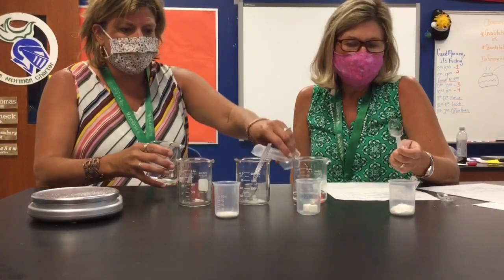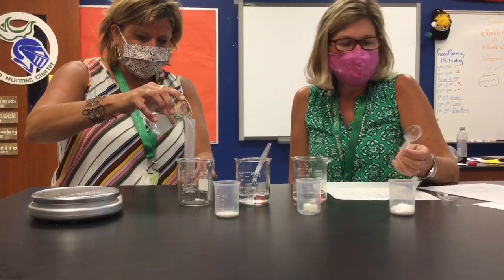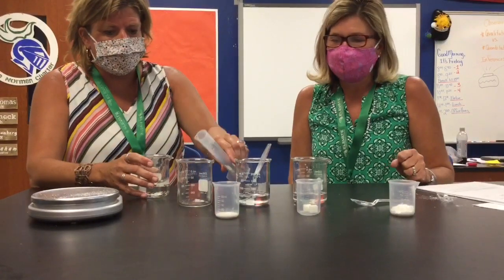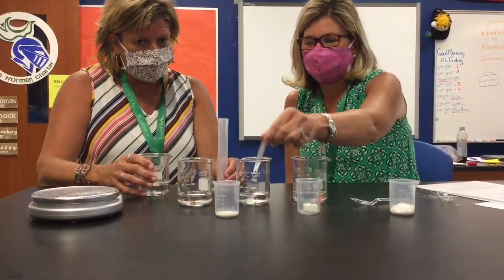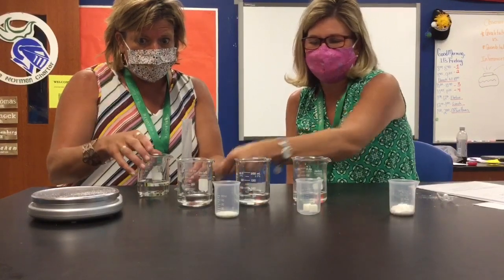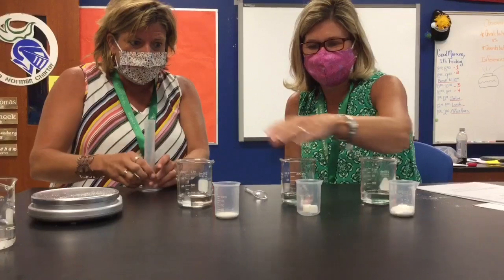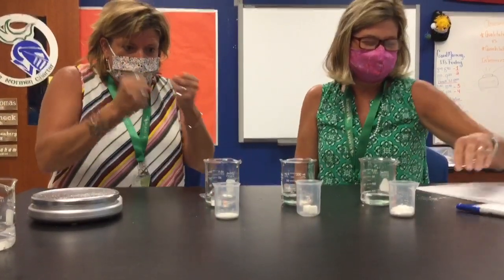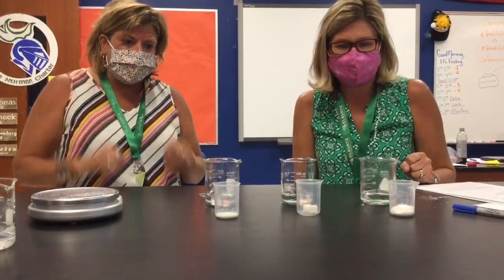And what we're doing on this one is we're going to determine if particle size makes a difference on the solubility of the sugar. Now, remember back yesterday when you watched video number 2 with Michael and his buddy, and they did 3 different things for the rate of solubility, right? Well, remember, this was one of them, the speed in which you do things, but also the particle size, and you can see that perfectly here.